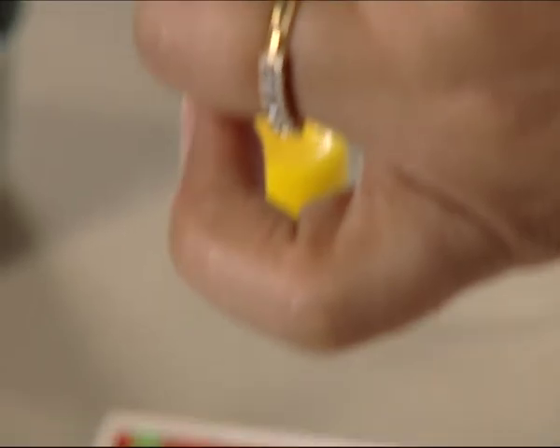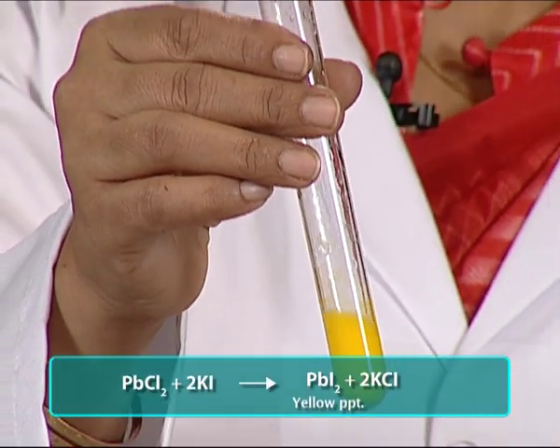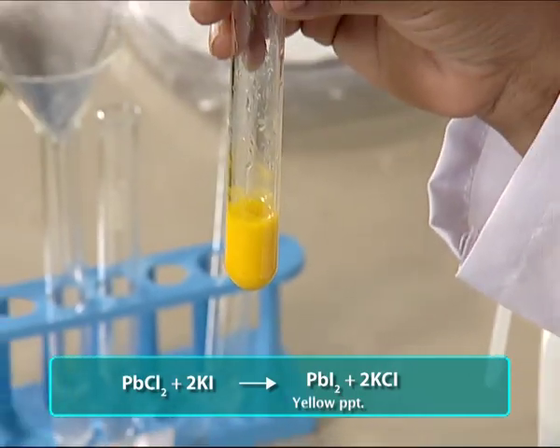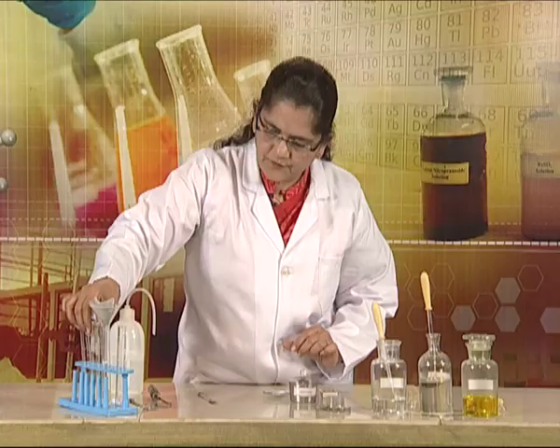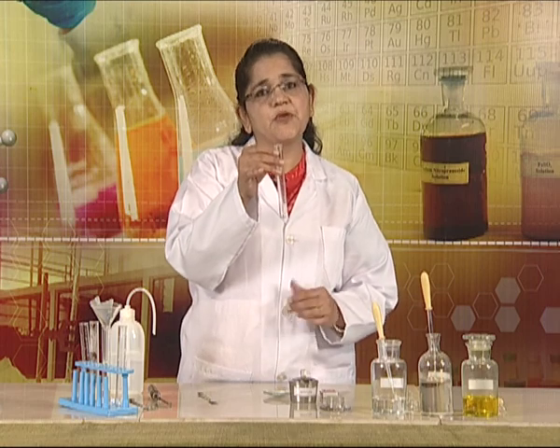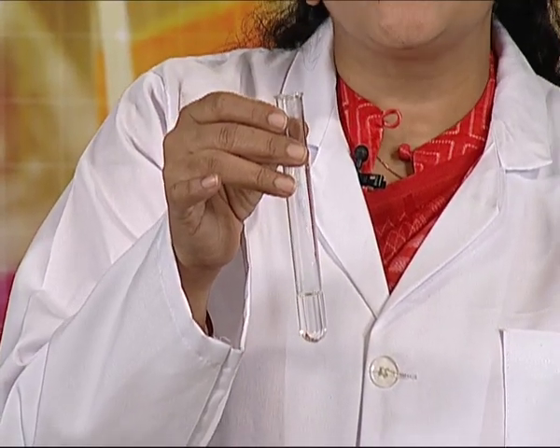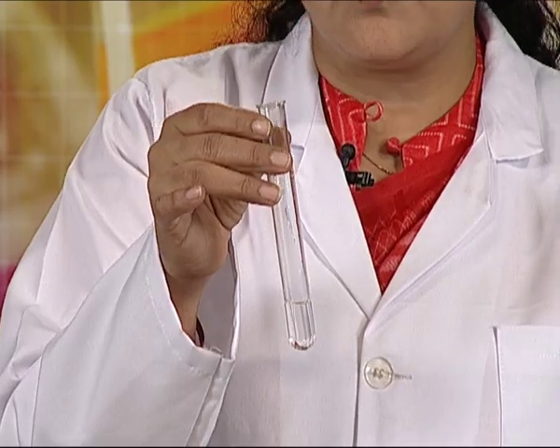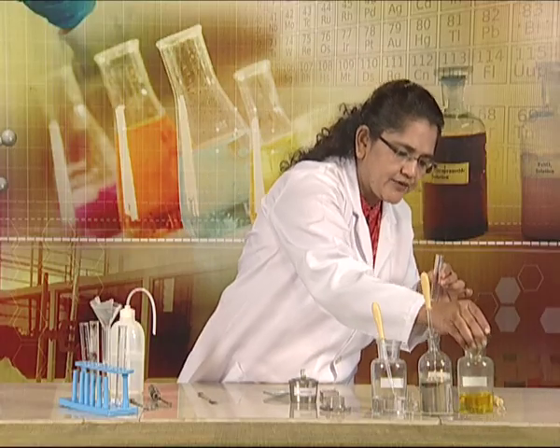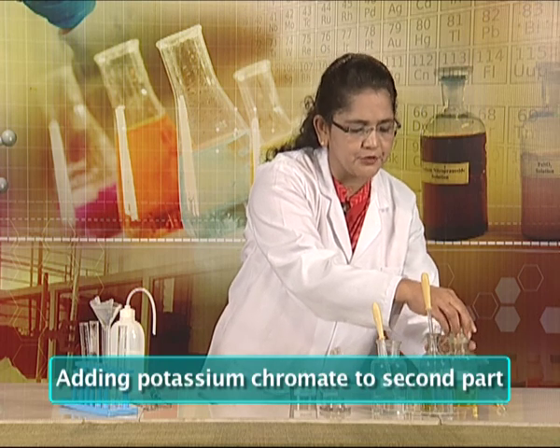The formation of a yellow precipitate indicates or confirms the presence of lead ions. Now, we will take the other part of the solution, which we have prepared by dissolving the white precipitate of lead chloride in hot water, and add the second reagent, which is potassium chromate solution.